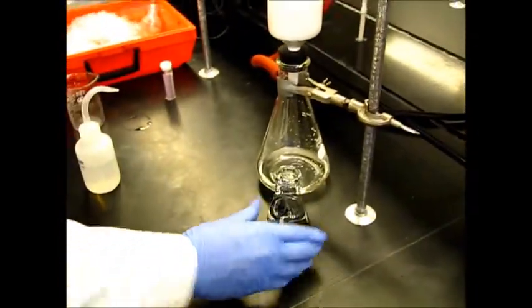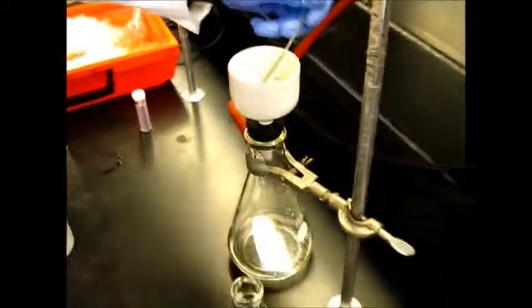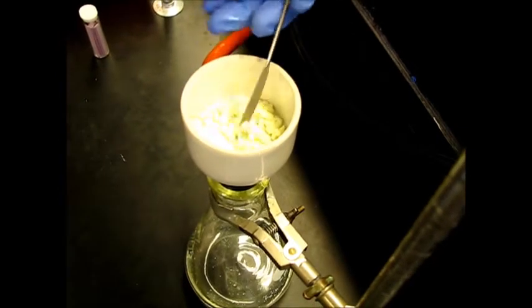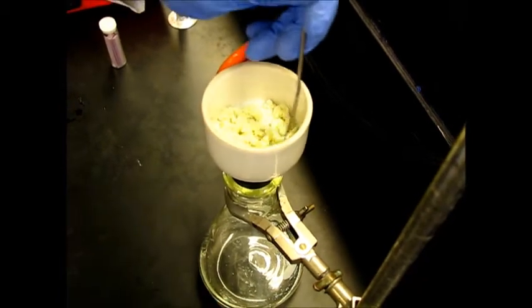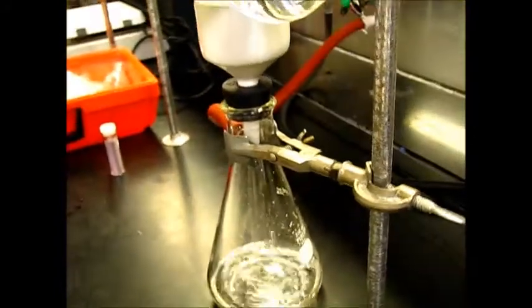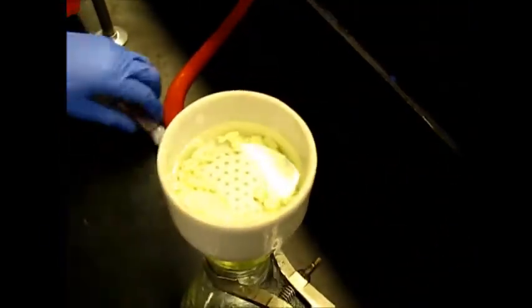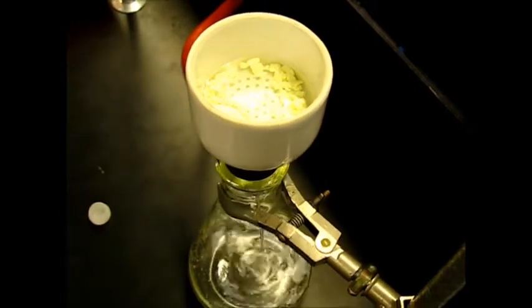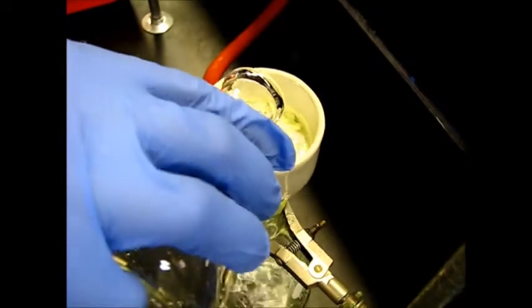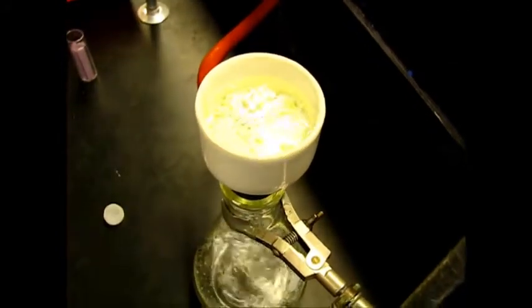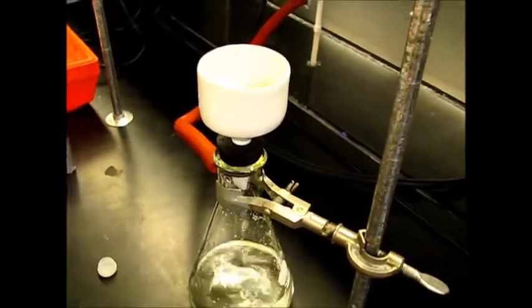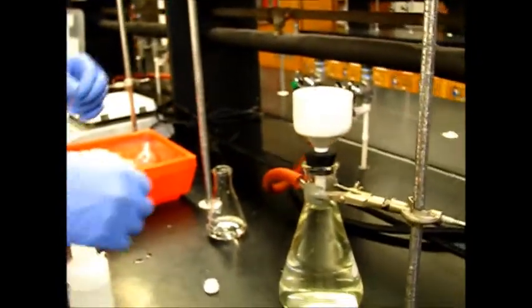It's ideal if you get your solid kind of pressed out so that more water can reach all of it instead of clumped up. It's a little bit hard with this stuff - it's still kind of sticky. And then we're just going to wash.